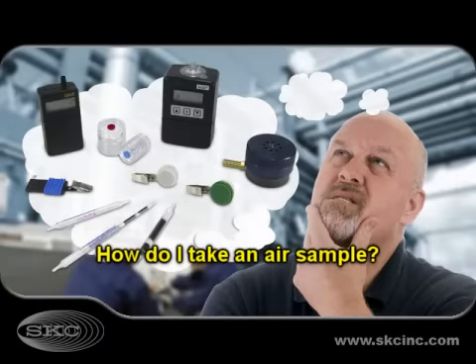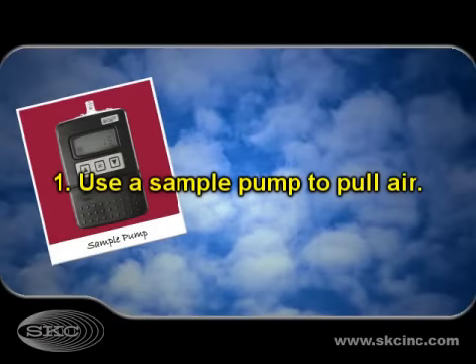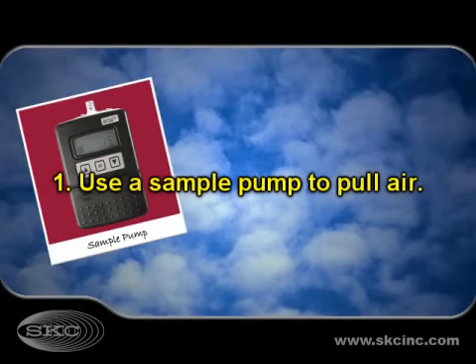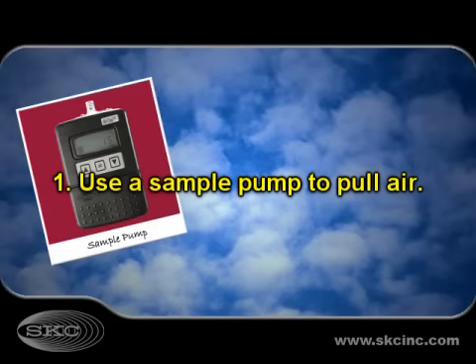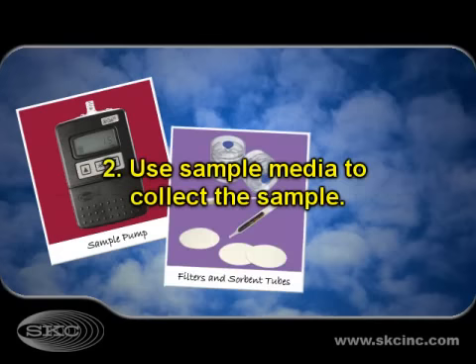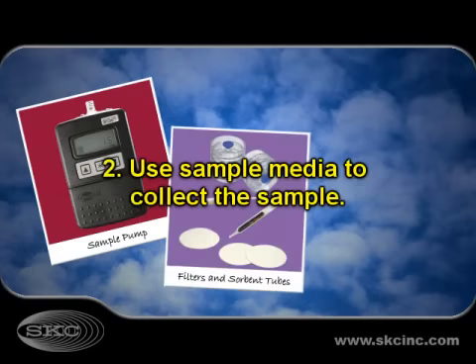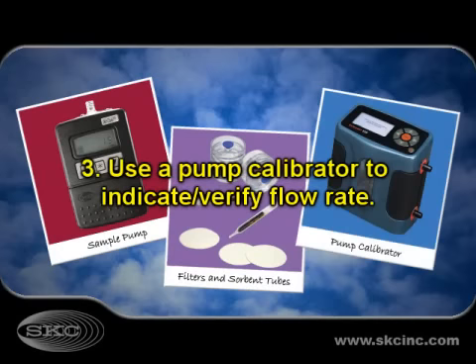How do I take an air sample? Active air sampling involves three things: one, a sample pump to pull air; two, sample media through which to pull the air; and three, a pump calibrator to indicate and verify how much air is pulled.